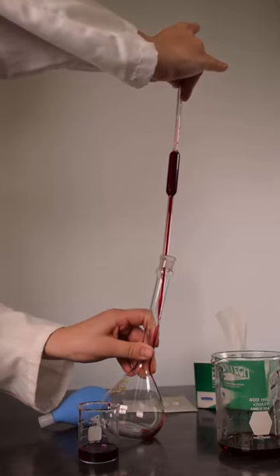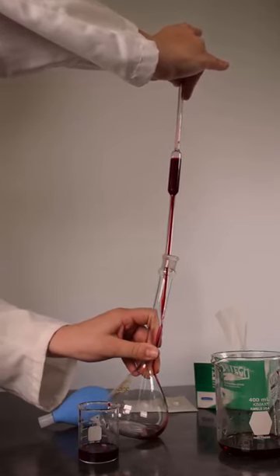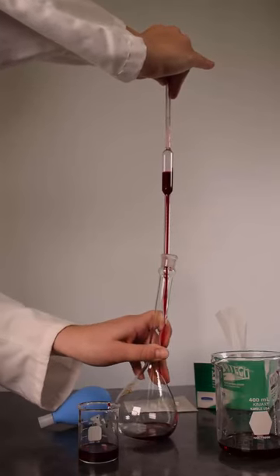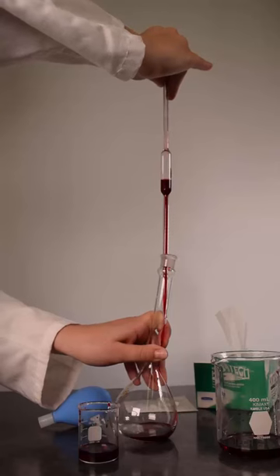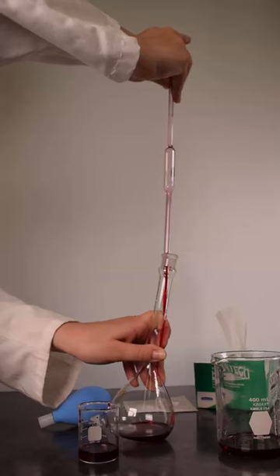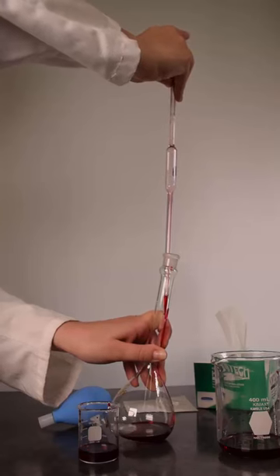Touch the pipette tip to the volumetric flask below the bulge point at the top of the flask and drain with the same procedure used with an Erlenmeyer flask. It is important not to touch the top of the volumetric flask with the pipette tip because any drops at the top of the flask will be trapped by the stopper when mixing.